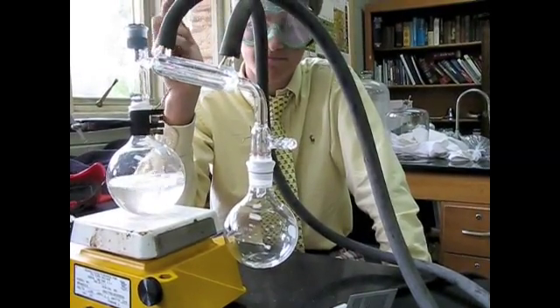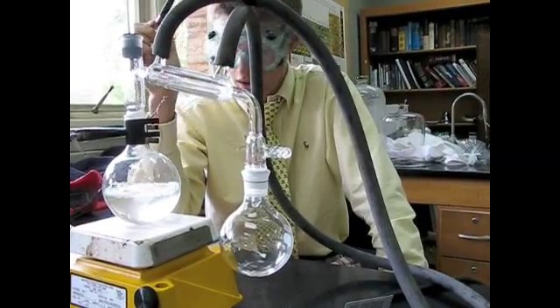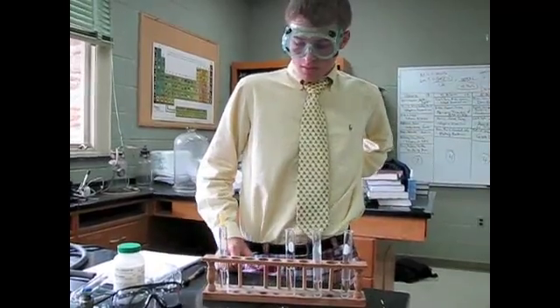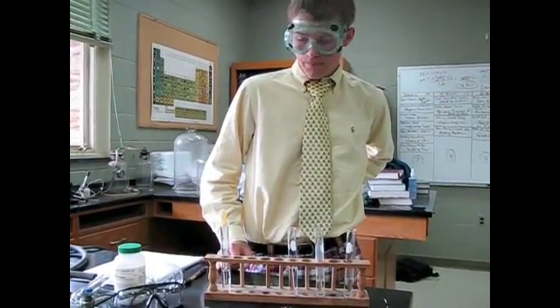How are you going to test whether there's salt in there or not? With silver nitrate. Alright Vincent, you're going to test your distillate and your original solution, so what are you going to test first?